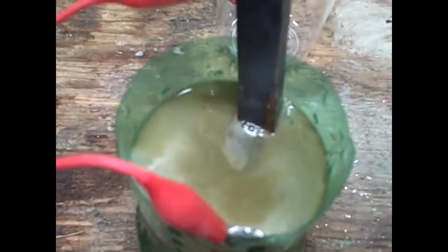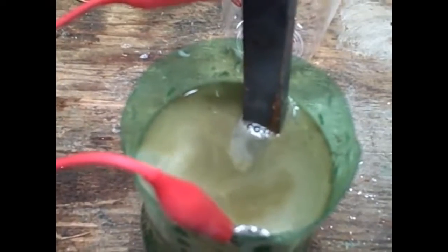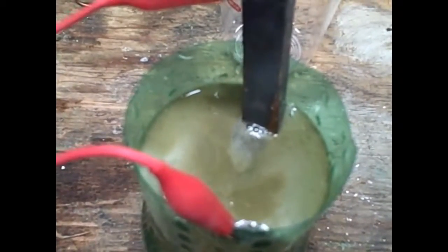And then we have some carbon slash iron type mix of railroad spike. The newer spikes are made with a carbon mix to help prevent them from rusting. It's already turning a different color — kind of a brownish, yellowish color. We took a sample from the container. You can smell a lot of chlorine. It's almost choking now.